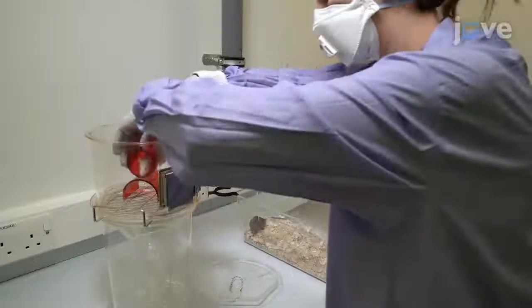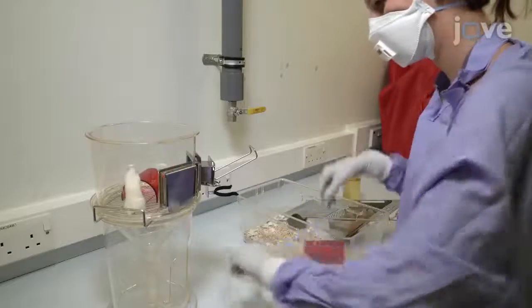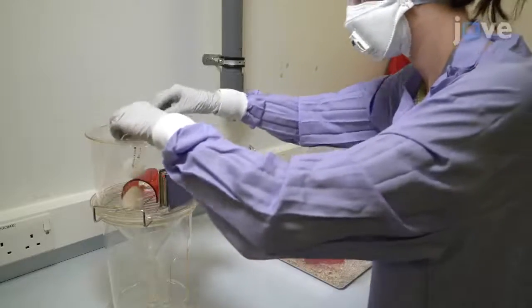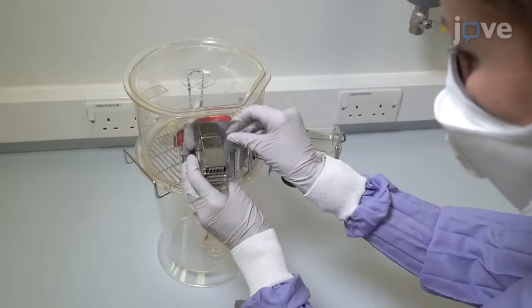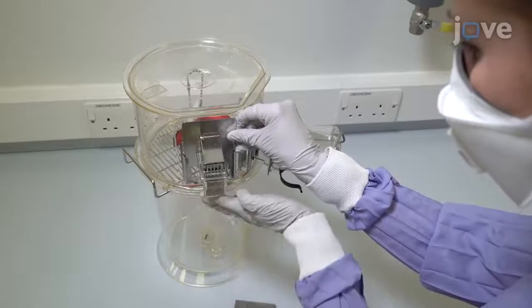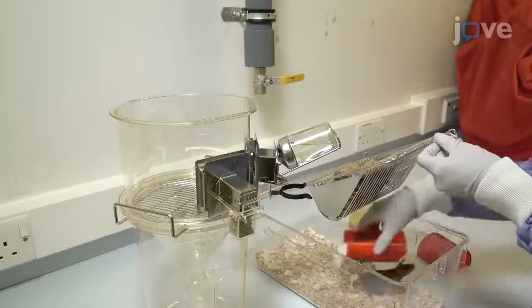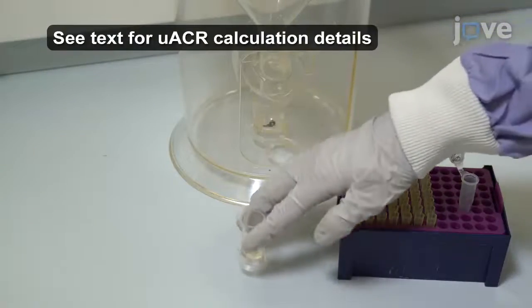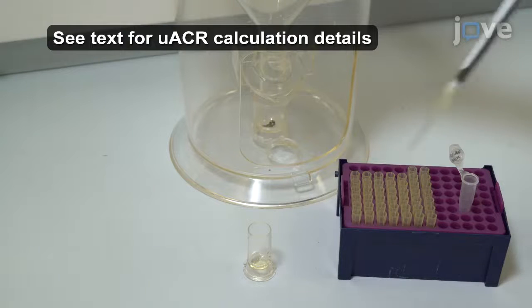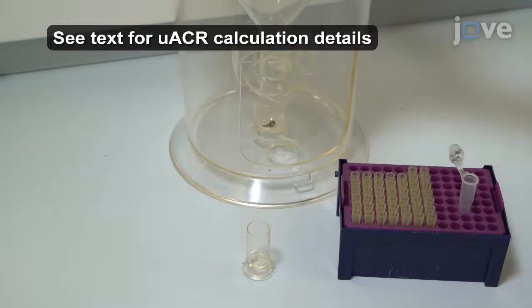For assessment of the urinary albumin-creatinine ratio, place one 6 to 8 week old male mouse into a metabolic mouse cage containing water and enrichment diet food in a quiet room. After 6 hours, return the mouse to their regular housing and collect a minimum of 50 microliters of the baseline urine sample from each cage, repeating the urine collection from once weekly to once monthly.